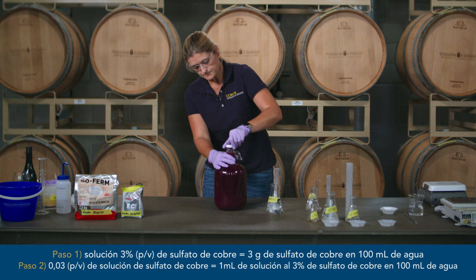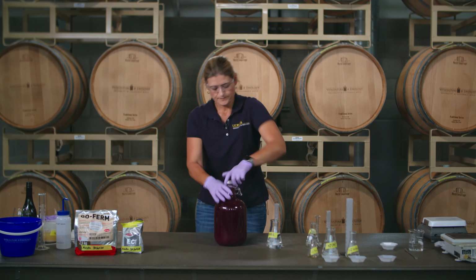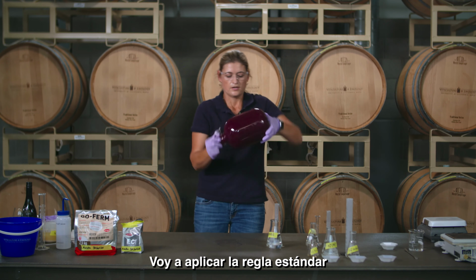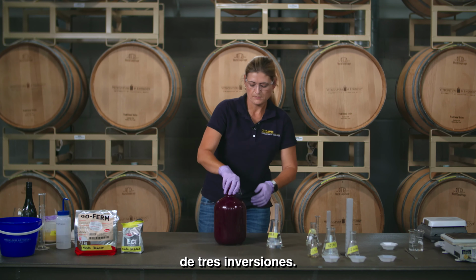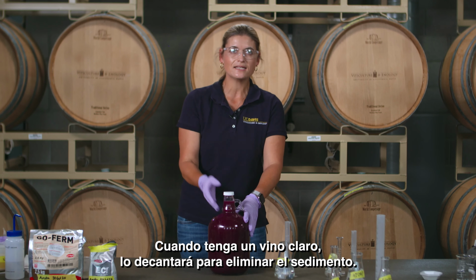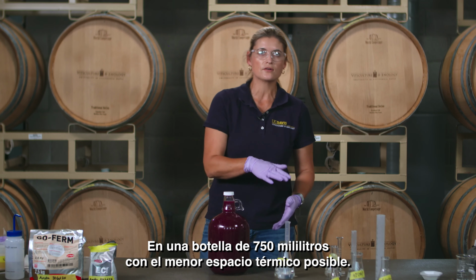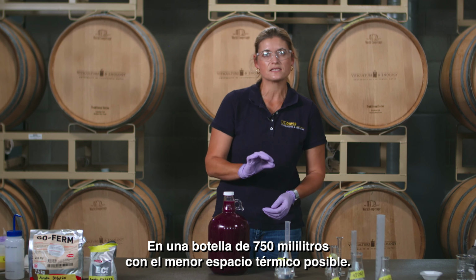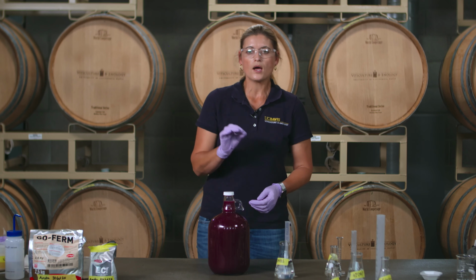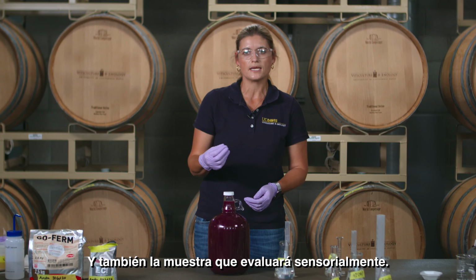Now we have to mix this in. If you can stir. I'm just going to do the standard rule of 3 inversions, which means complete mixing. You're going to put this into a refrigerator. It needs about 1 to 2 days to settle because you really want a clear wine. When you have the clear wine, you will decant it off the sediment into a 750 milliliter bottle with as little headspace as possible. And that is the sample that you will be sending for lab analysis, and also the sample that you will be evaluating sensorially.